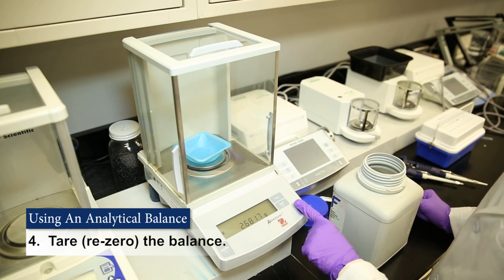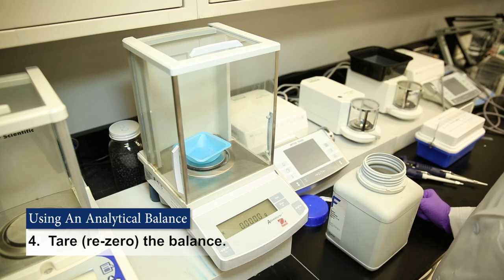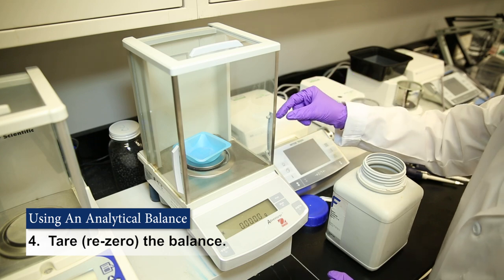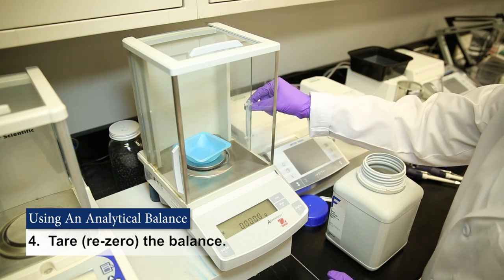And then you'll use this button called the zero or tare button to make sure that it has a reading of zero. And that makes it so it's not taking your container into account when it's telling you the mass.